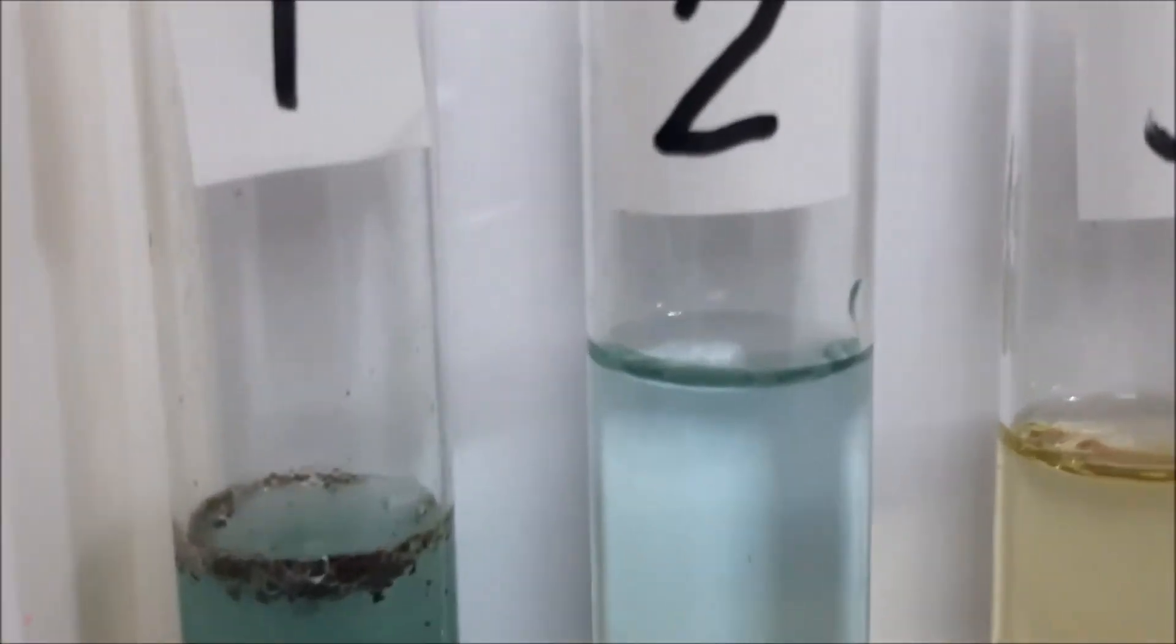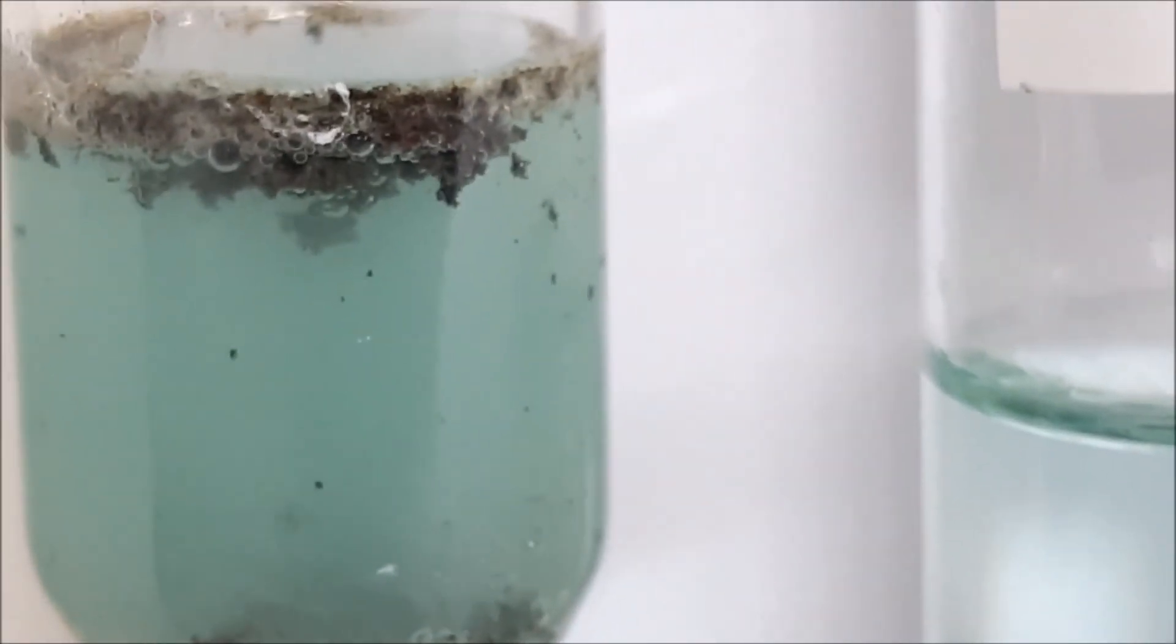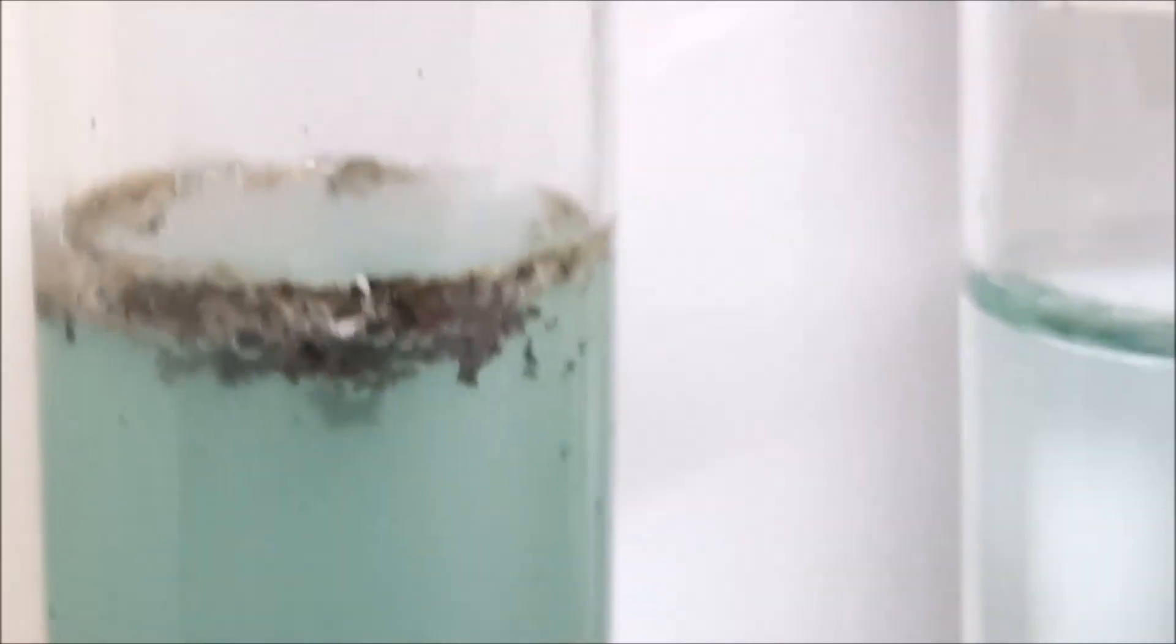Let's see the summary of our experiment. For number one, we have magnesium plus copper sulfate. So in this test tube, we can see that the copper is deposited on the liquid.